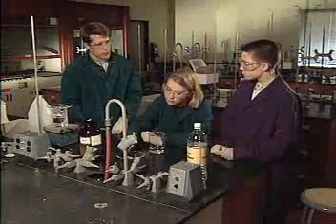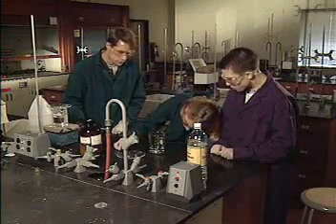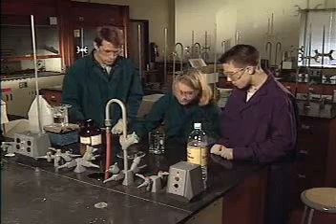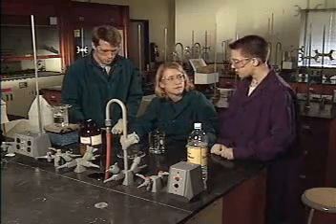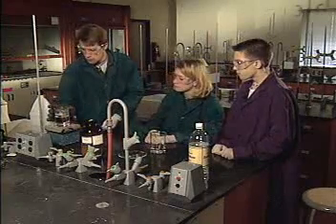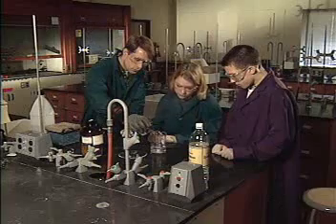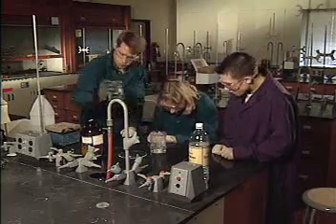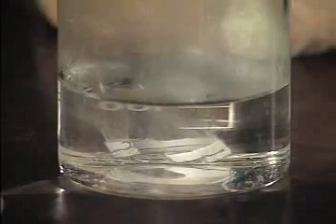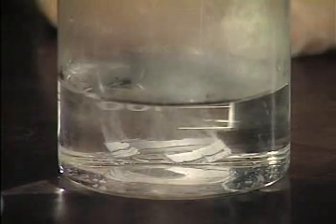Let's see what calcium metal does in water. Not much happening. We should add some energy to see if it makes a difference. Okay, let's try it. Whoa, there it goes. Definitely some bubbles. But not too fast of a reaction. The calcium stays at the bottom.